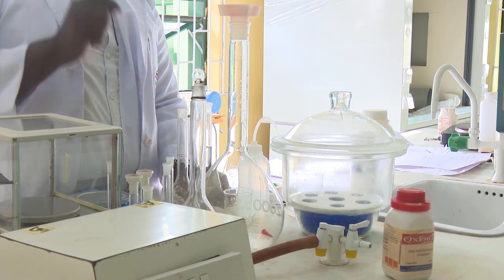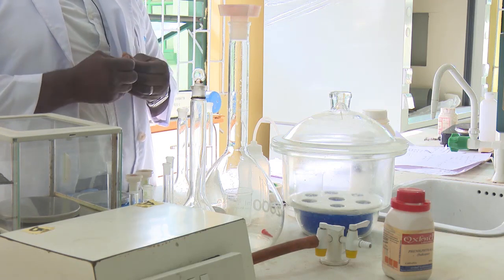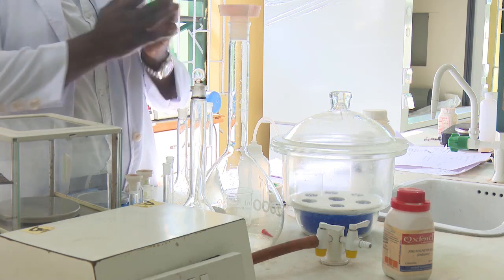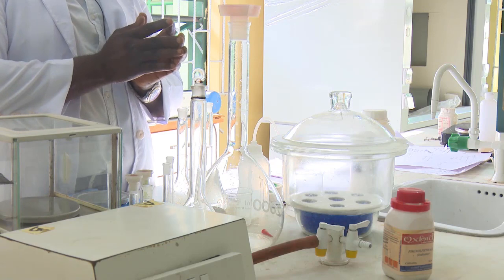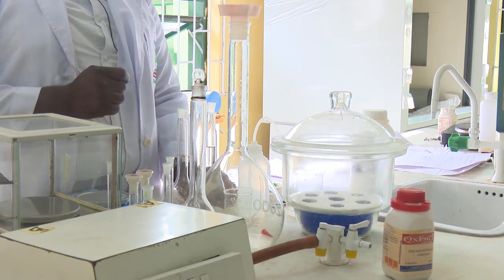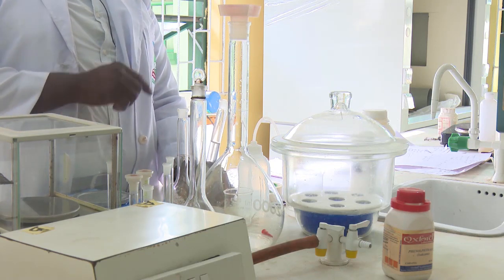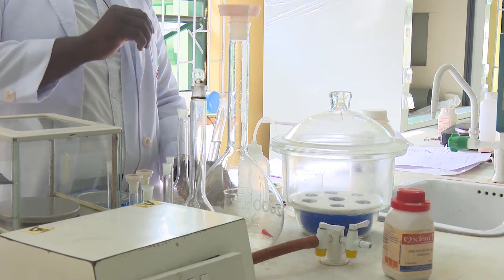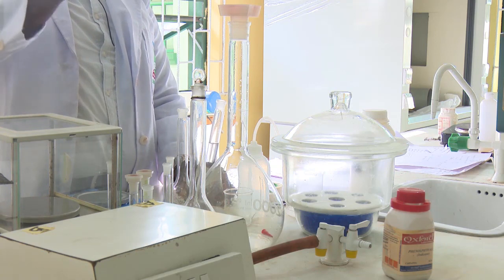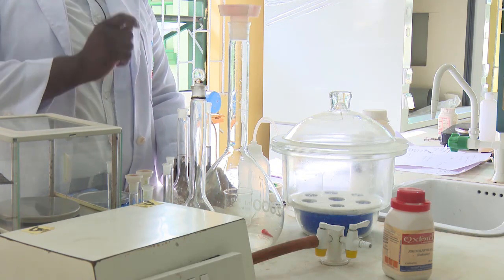Now, because we are the ones to determine how much concentration we need to prepare, for example, we are preparing 0.1 molar of sodium carbonate in 250 cm³. From the serial dilution formula, V1, which is the volume of the original solution, is equal to M2 times V2 all over M1. Our M2 is the concentration we want to prepare, which is 0.1. Our V2 is 250 cm³, the volume you want to prepare your 0.1 molar in. And your M1 is your initial concentration, so you divide 0.1 molar times 250 all over 1 molar. When you do this calculation, you are going to have 25 cm³.